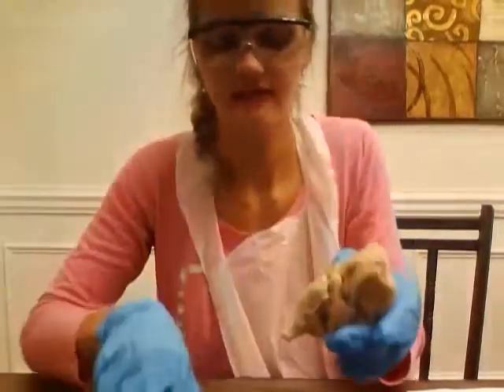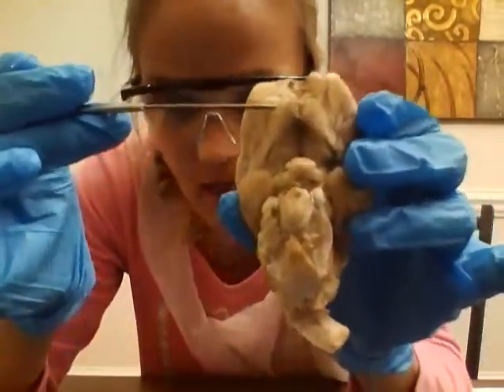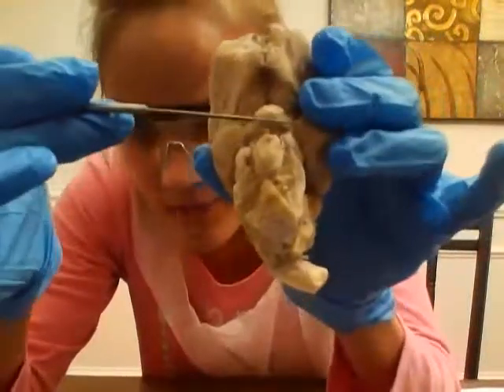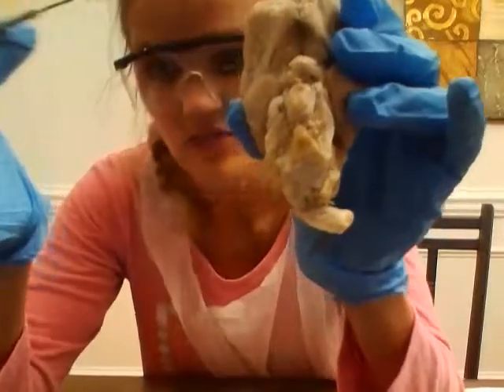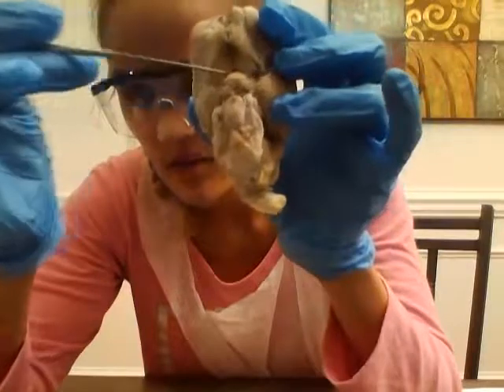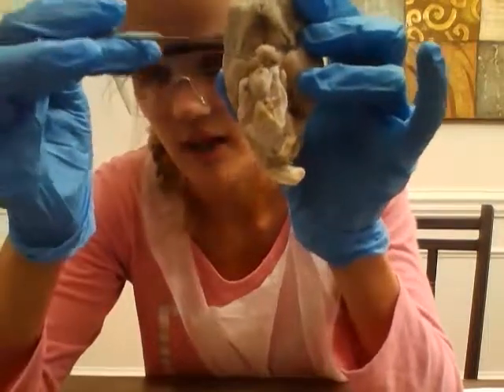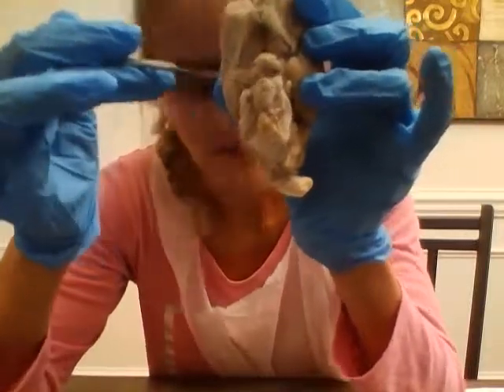Going on to my nerves, I have all my nerves intact, so that's good. So I can kind of show you. The olfactory bulb and the olfactory nerve right here. And then moving on to my optic nerve. We have the optic chiasm right here, this X-shaped. I didn't have a dura mater on mine, so I'm not sure if I mentioned that. If the dura mater was still on, you should be able to see it, but they disconnected it. And then the optic tract is pointing down.